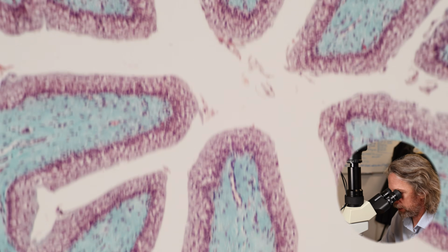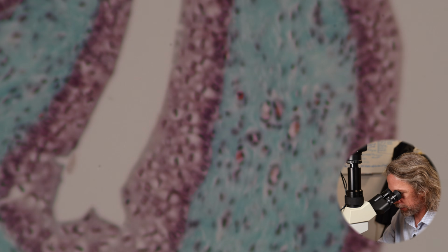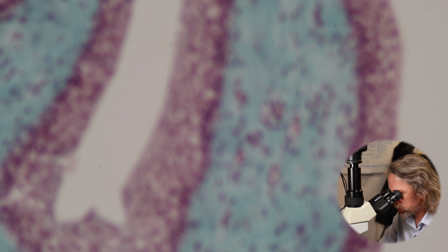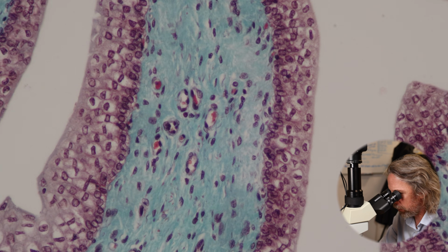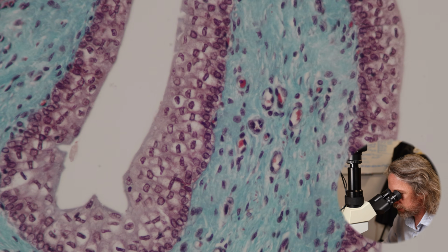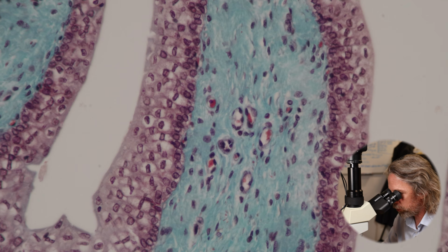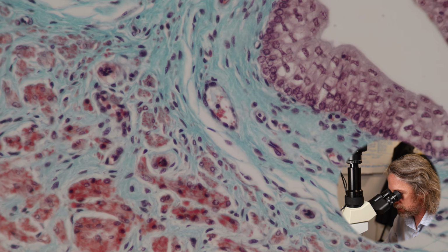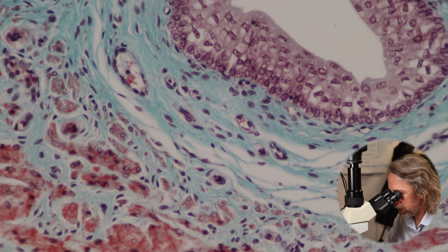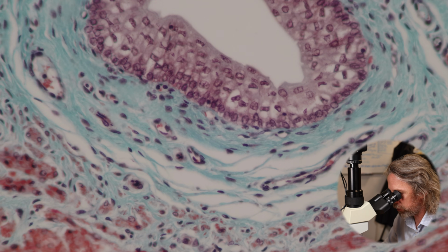Now the lamina propria here in green is fibroelastic, it is stretchy. So you've got elastin fibres in there, so it can stretch and continue to support the urothelium. And look, hopefully you can see those little tiny blood vessels in there. They've got a couple of red dots in there. Those are red blood cells. So we've got some small blood vessels in there. There will be nerves in there as well. And you can see that as we go to the edge, it continues around there like that. So the lamina propria is a fibroelastic, stretchy support layer.